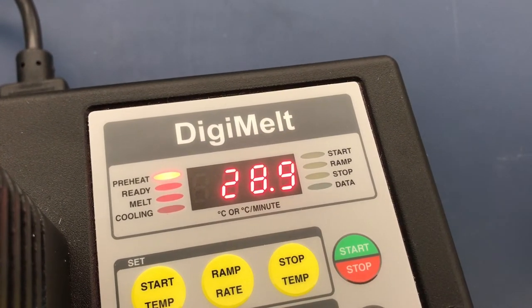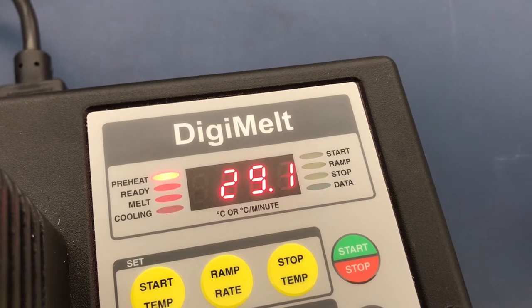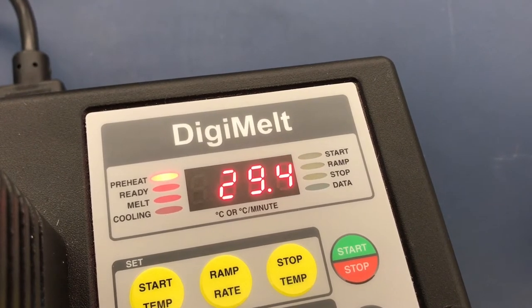Now press start and allow the DigiMelt to preheat. The light will change from preheat to ready.